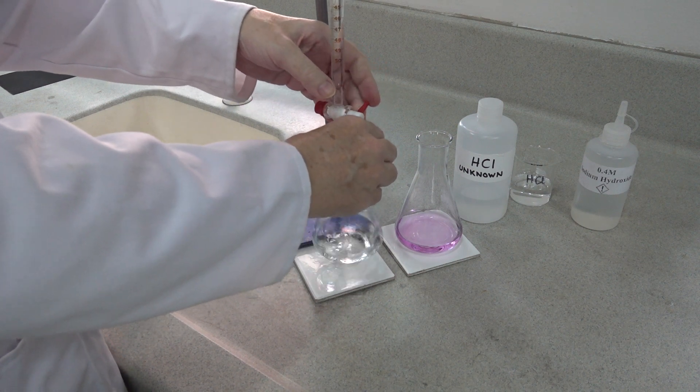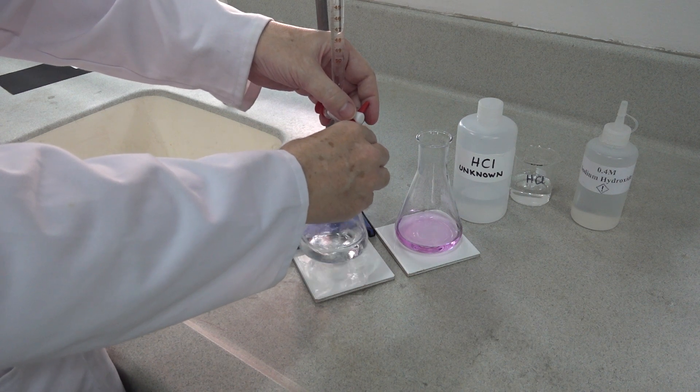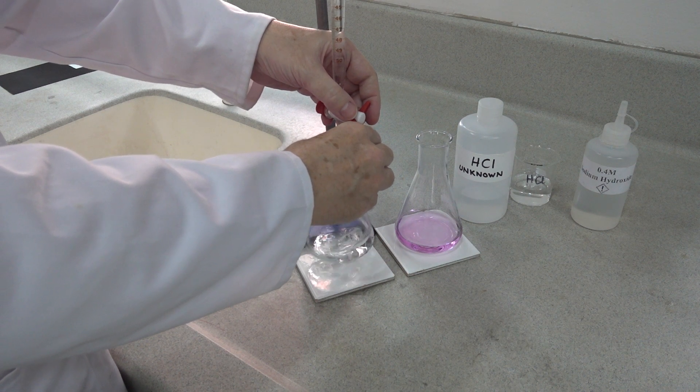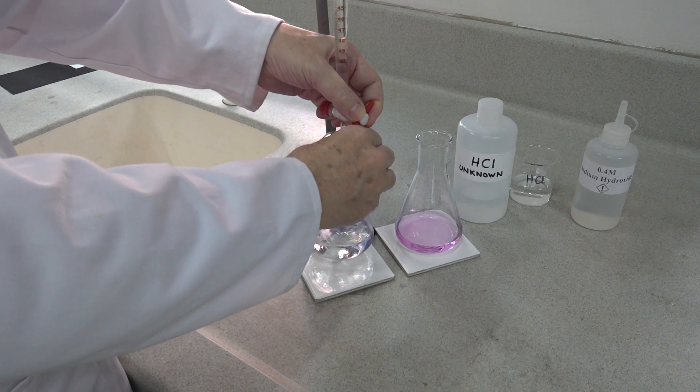There we are. Now, if we double 21.7, we get 43.4, and that ought to be around our endpoint.